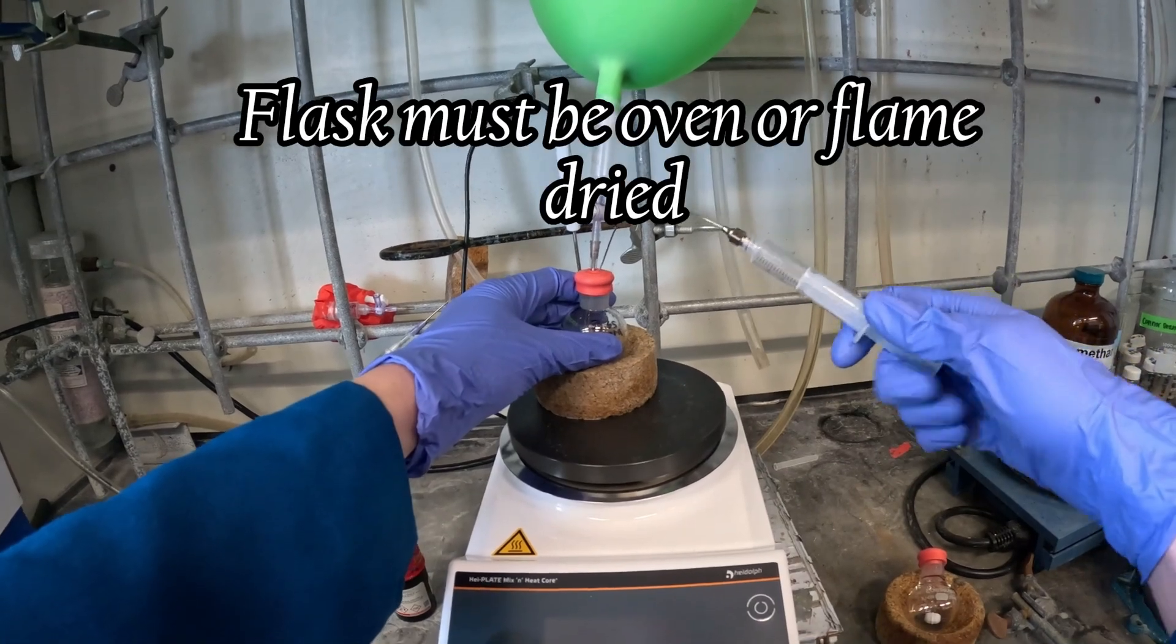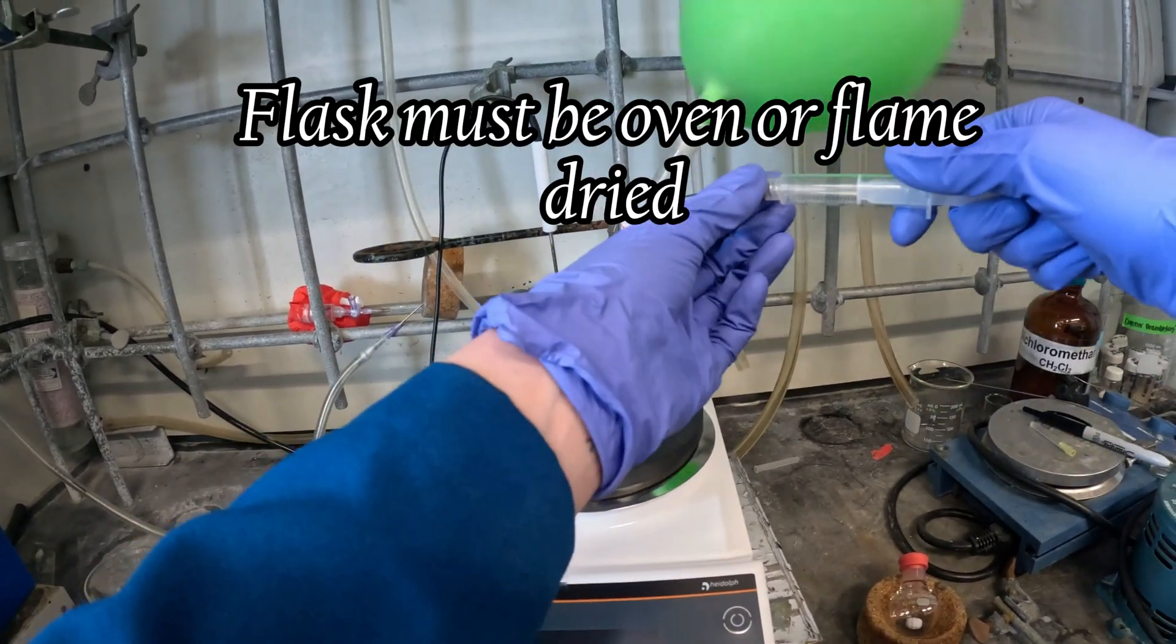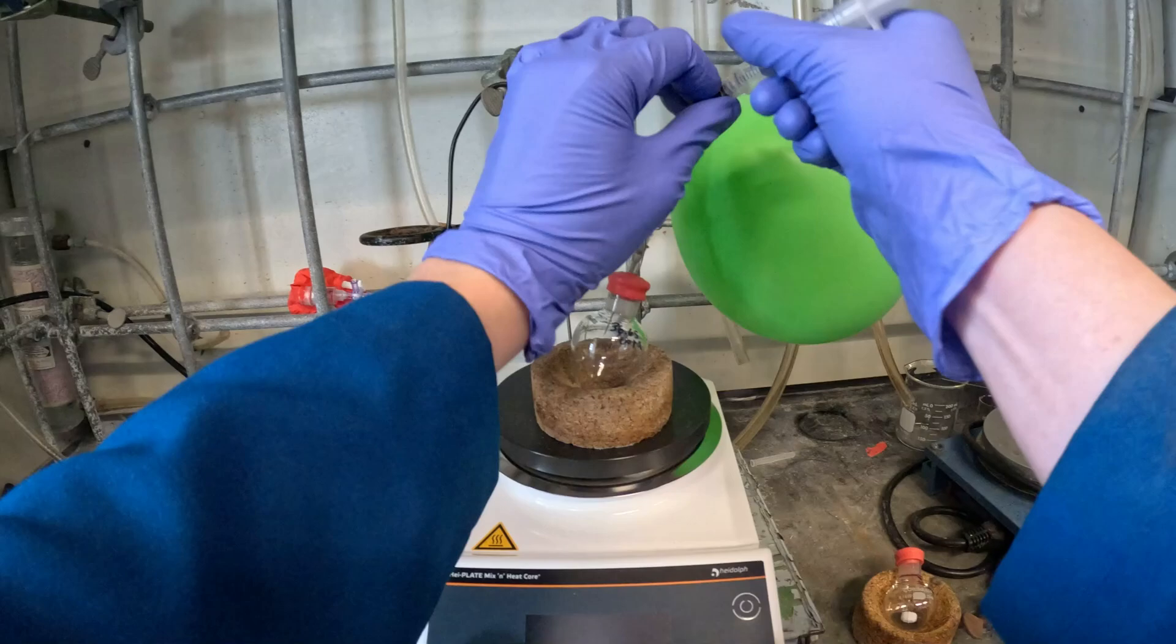It's important that you have an argon environment and no water, because BBR3 reacts violently with water.